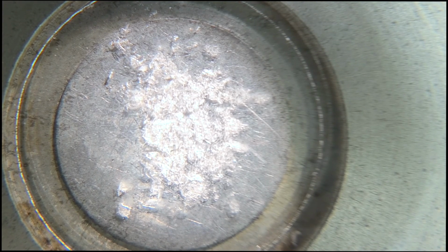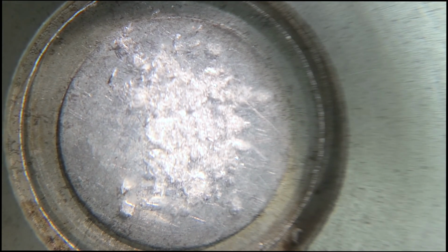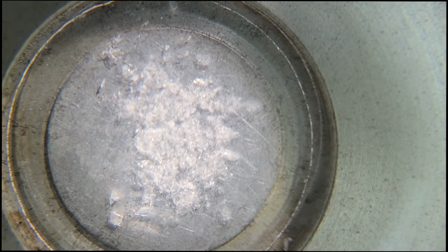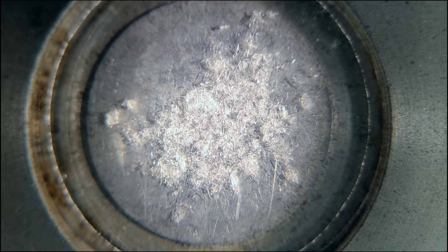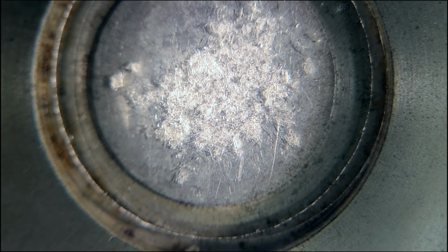Alright, so we're at 111 degrees right now. It's taken a very long time, like maybe 10 or 15 minutes to get here, but it's slowly increasing, and we're almost at 112. And hopefully, with any luck, the solid will begin to melt. Oh! It's melting! At 115.